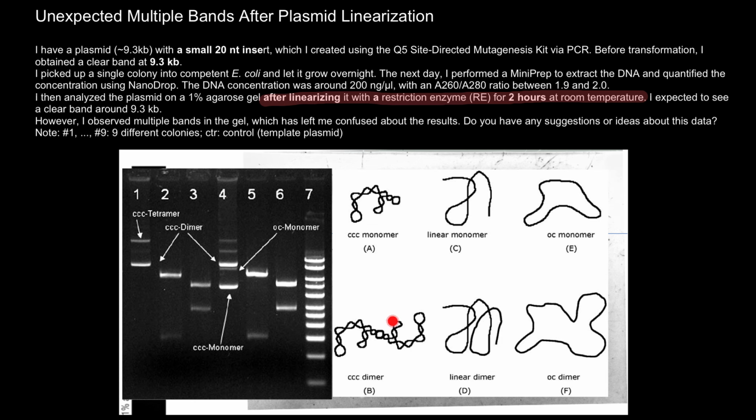So we call them different species, but this is not all the different variants that are possible. It's just the most common. And of course, every configuration here would give us a different band when we run a gel. I wonder if the enzyme has bound to the plasmid but has not cut it. And you have coiled plasmid, possibly with the enzyme still attached, in which case adding 0.5% SDS might alter the mobility of the plasmid, but the problem may not happen if you cut for longer and at a higher temperature.